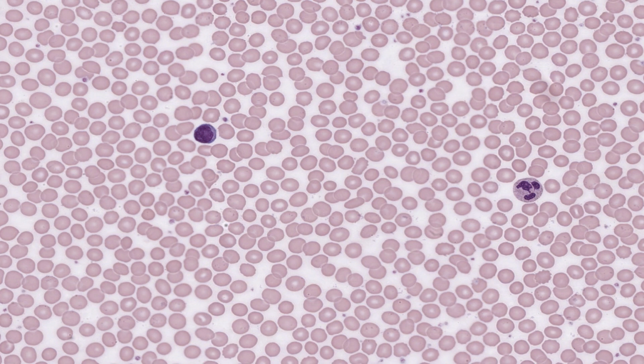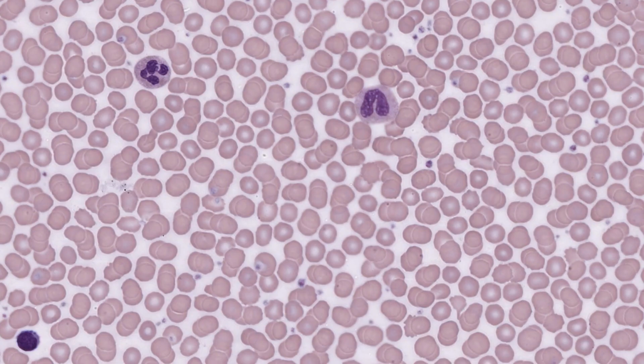Medium-sized lymphocytes have an intermediate appearance. Some large lymphocytes have a few large, obvious granules in their cytoplasm, not visible in this image, but they're still considered to be agranulocytes. These lymphocytes are natural killer cells that survey the blood for incipient cancer cells. The small lymphocytes are mainly T cells, or T lymphocytes, with about 10% being B cells, or B lymphocytes.